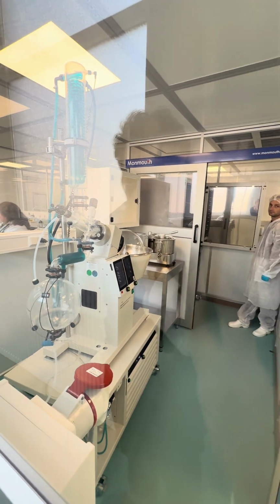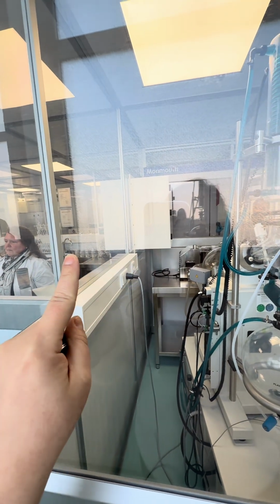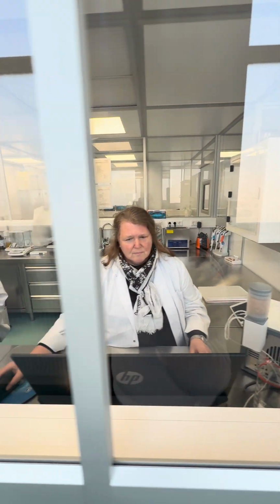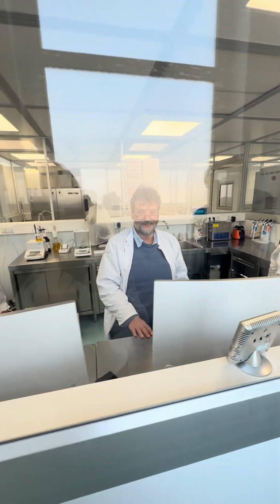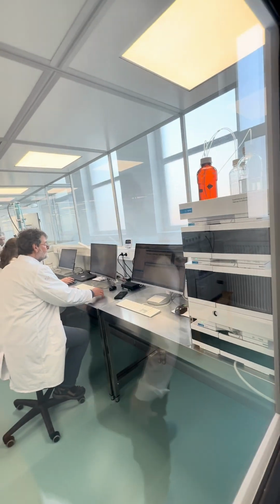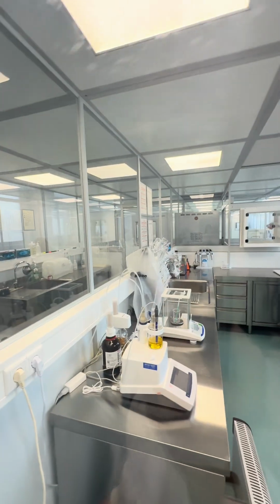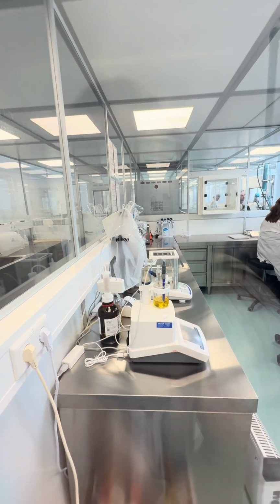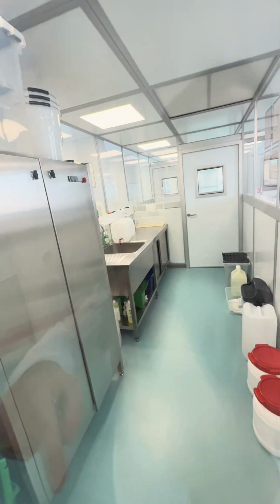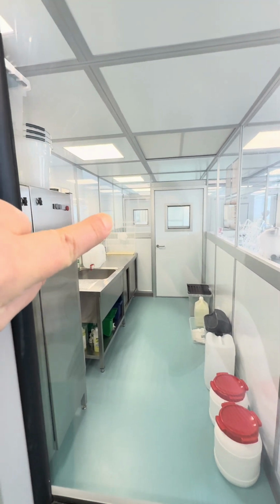And the clean room communicates with the analytical lab through another airlock. They are exchanging samples through this airlock. And here is our analytical lab with our 2 employees of the laboratory. We have an HPLC here. And other equipment. The last one is a washing room that communicates with the clean room through another small room for changing materials.